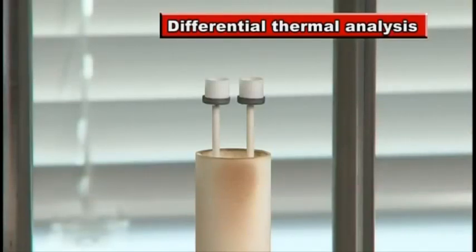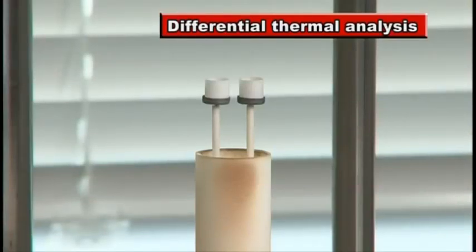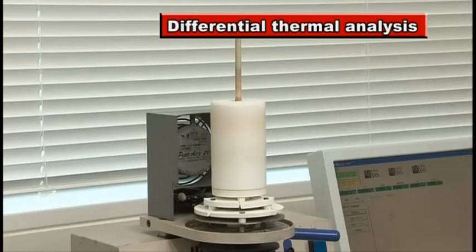Differential thermal analysis reveals the ignition properties and combustion properties of fuel oils.